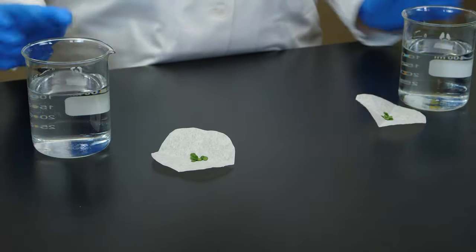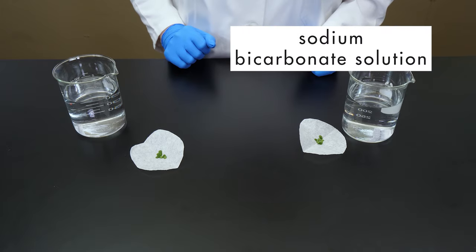We also need two beakers, each containing a 2% sodium bicarbonate solution.